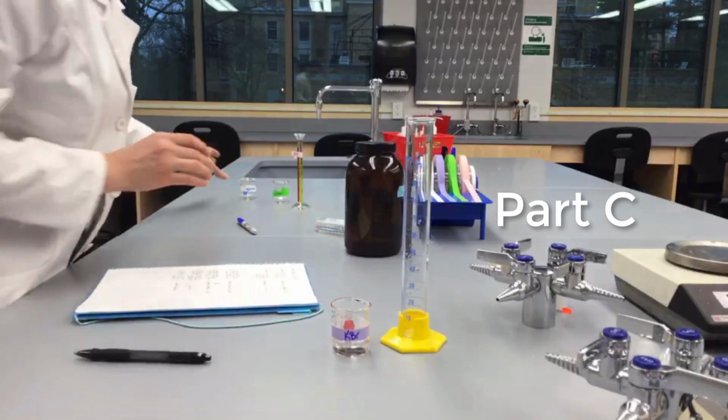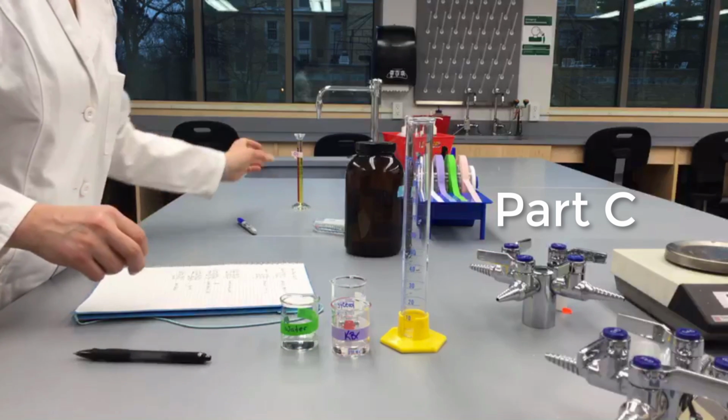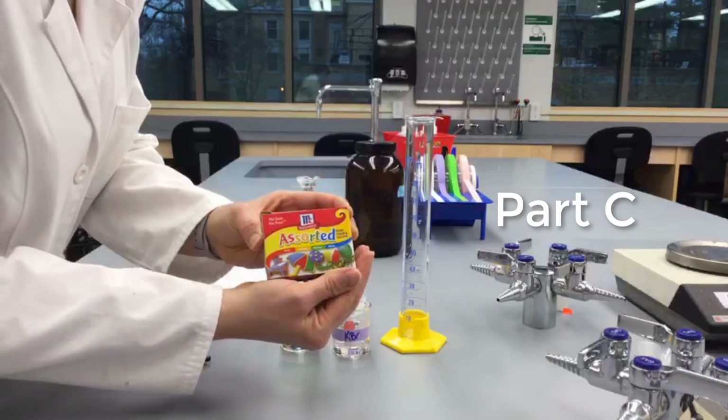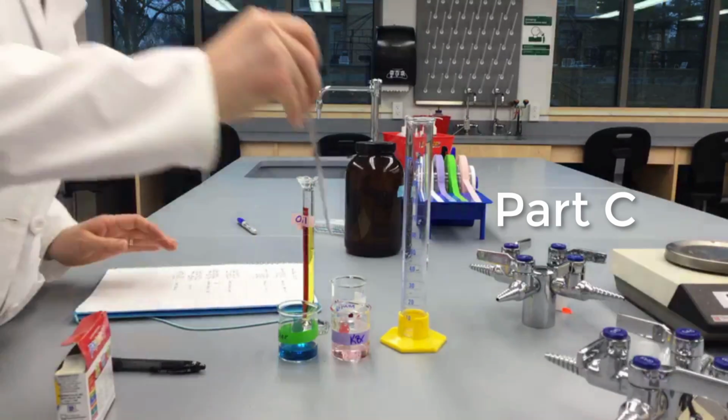After you determine the density of each of the 4 liquids, you should order them from most dense to least dense. At this point, you can add just a small drop of food coloring to your heaviest liquid and the third heaviest liquid if you want to make the next part more fun.